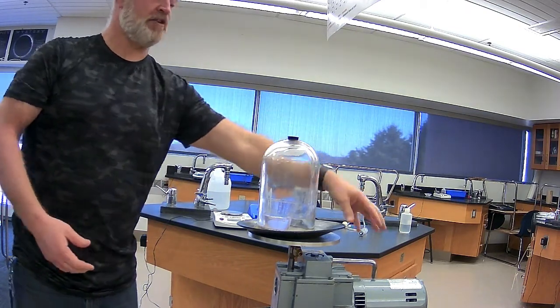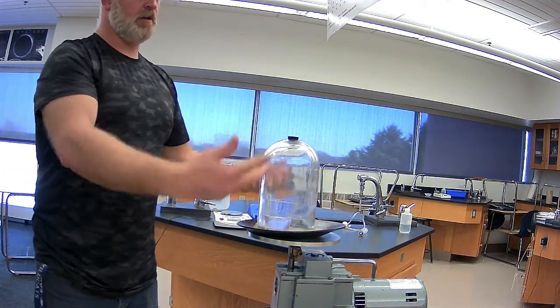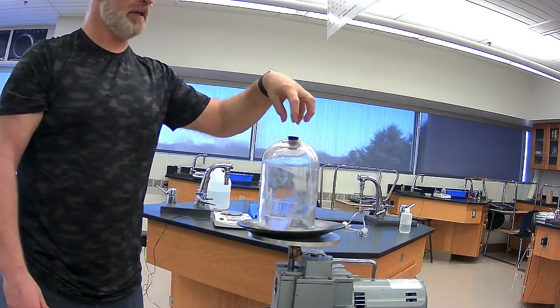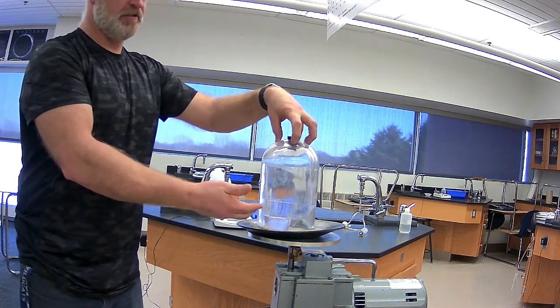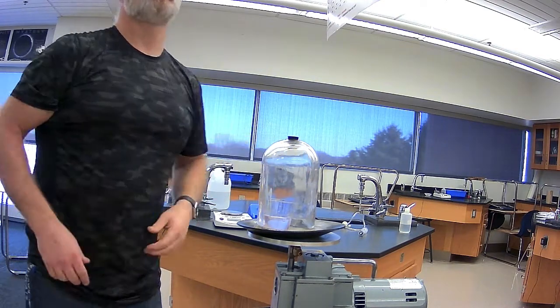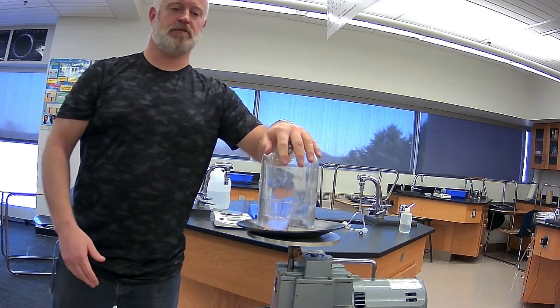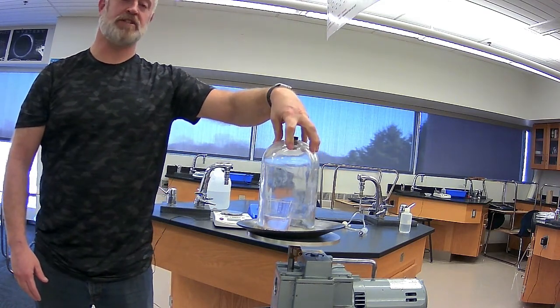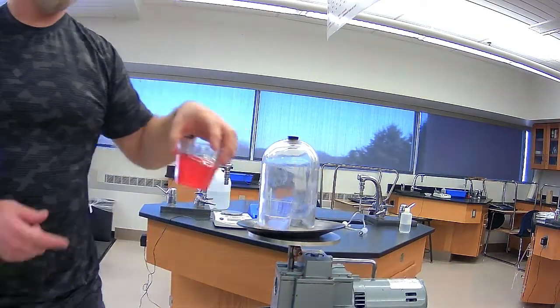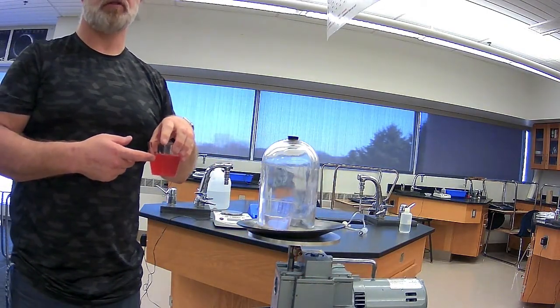When I turned the vacuum pump on, we were drawing the gases out, creating vacuum or decreasing the pressure. By decreasing pressure above that solution, the solubility of the gas inside that solution decreased, and as a result, the bubbling happened. Okay, so we see that relationship that we've already talked about in our notes. This is just an example of how we can look at the relationship between gases as solutes in comparison to how we see no real effect of change in pressure for our solid solutes.